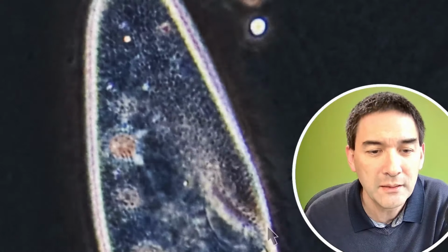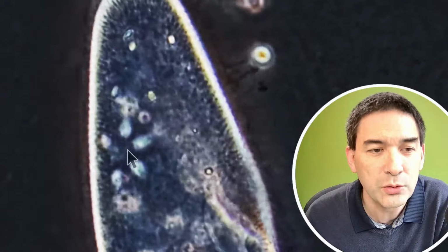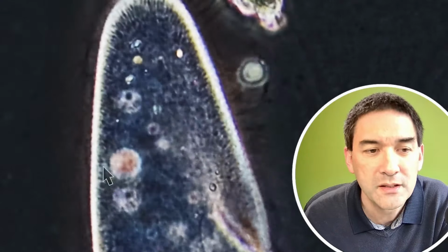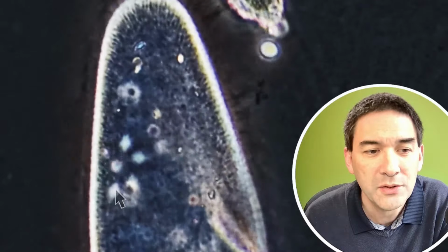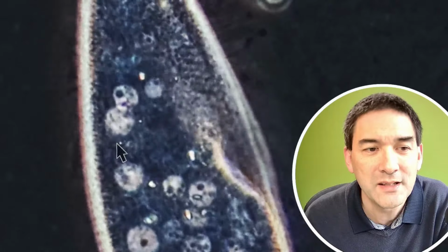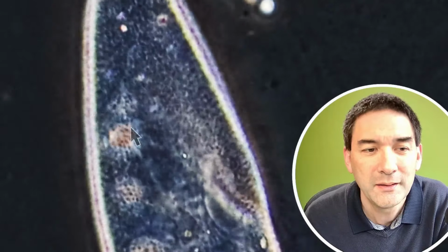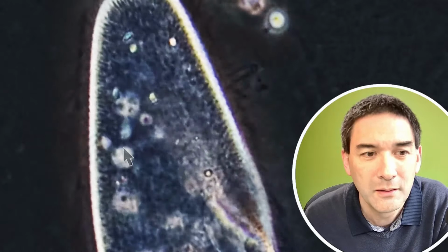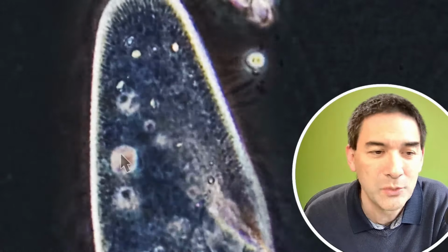Okay, and over here again, look, here it is, the contractile vacuole in the center. It starts to fill up with water. Right, it looks now quite bright. You see those 1, 2, 3, 4, 5 supplying canals around it. And then again, when it's full, it pulls together and it pumps the water out.